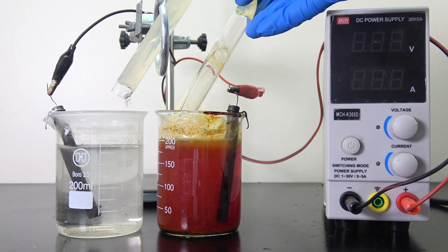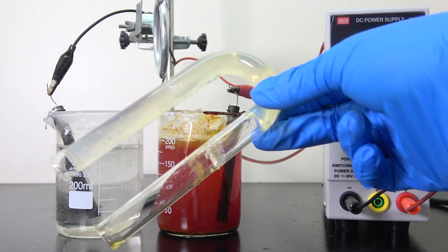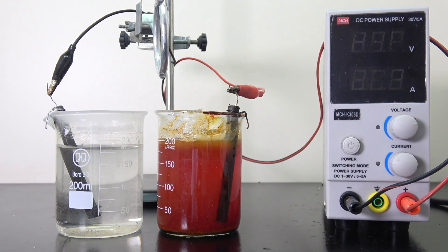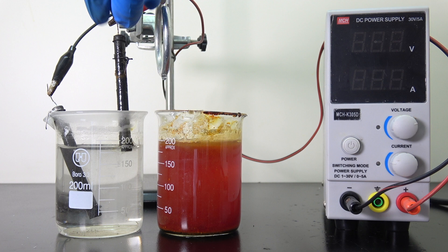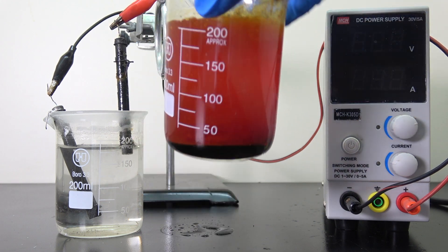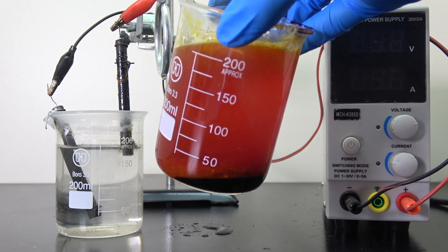Looks like the salt bridge is somewhat damaged by the bromine and adds lots of impurities to the product. That will be removed in later purification. But most importantly, we can see the deep reddish-brown liquid sitting nicely on the bottom of the beaker.